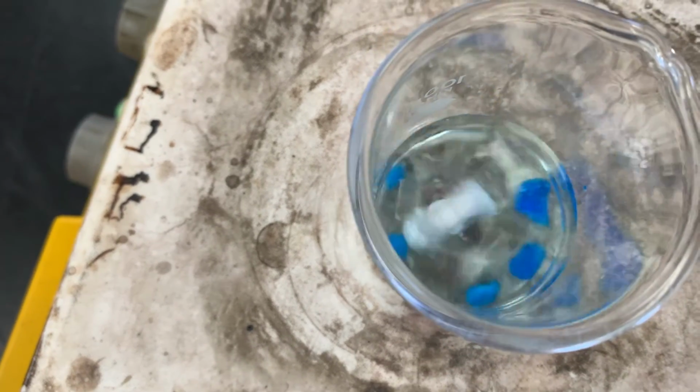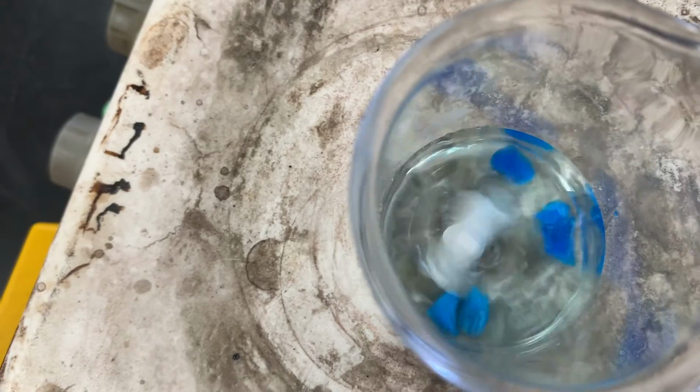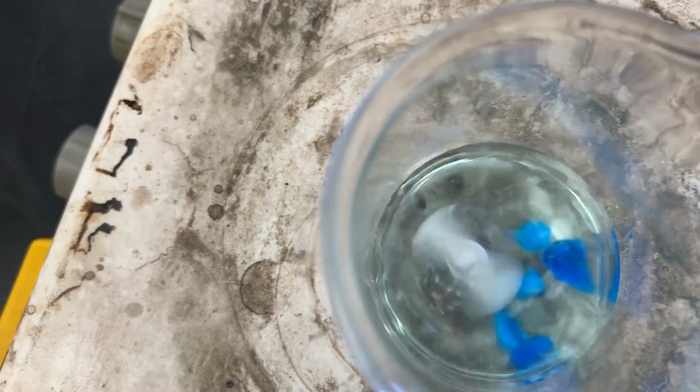So what we'll do on this video is we'll cut out some of the middle time while you're waiting, and then you'll need to see what the time on the timer says once this is all dissolved. Make sure you watch all the way to the end so that you can see what time this finishes dissolving at.